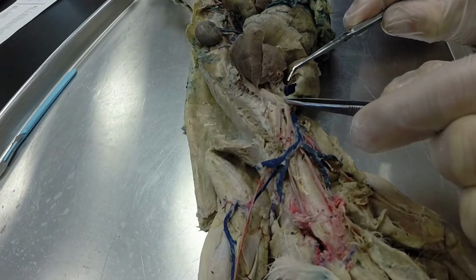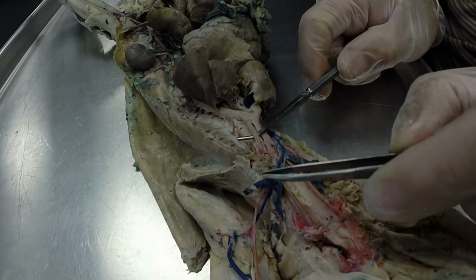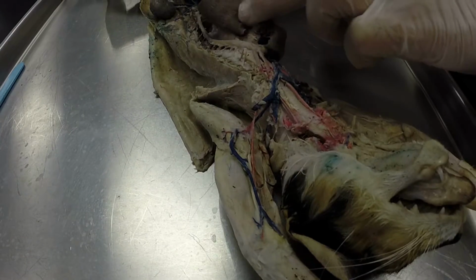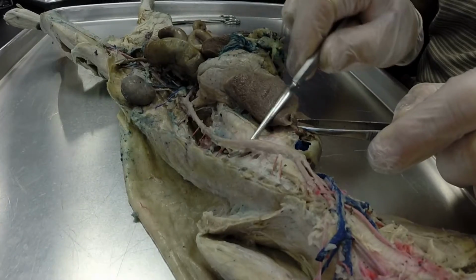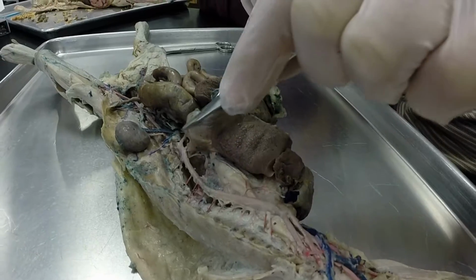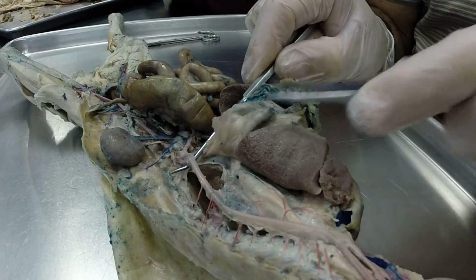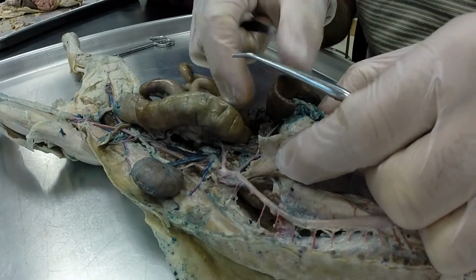Okay, back to the aortic arch over here. Our next branch is the left subclavian artery. And then in the armpit area, this is the left axillary, and then the left brachial artery. Going down now, this is going to be the descending thoracic aorta right here, where it's in the thoracic cavity. Then it's going to cross through the diaphragm, which is this flap right here, and it's going to become the descending abdominal aorta.